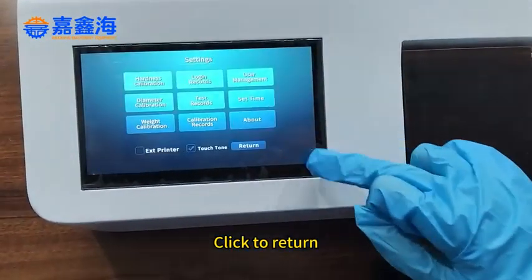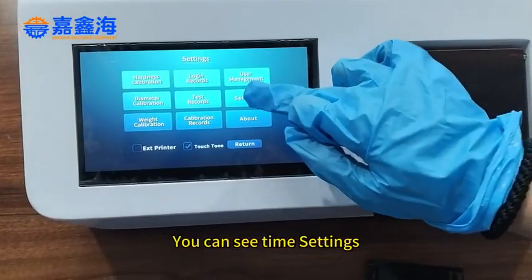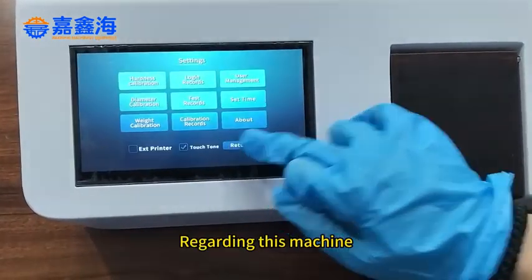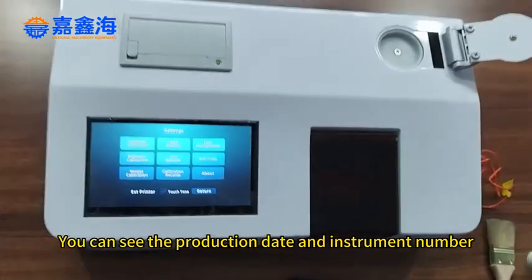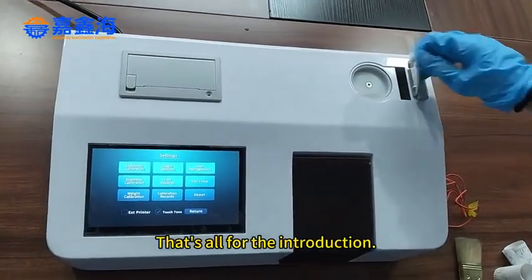Click to return. You can see the time settings. Regarding this machine, you can see the production date and instrument number. That's all for the introduction.